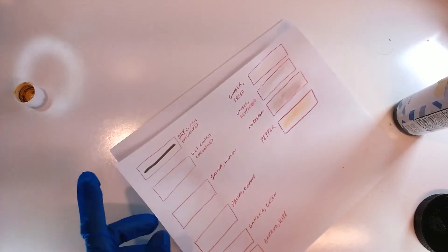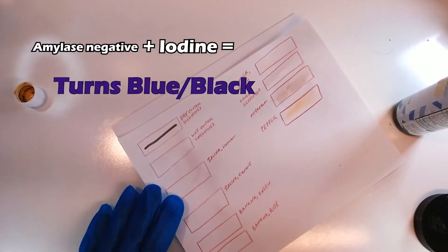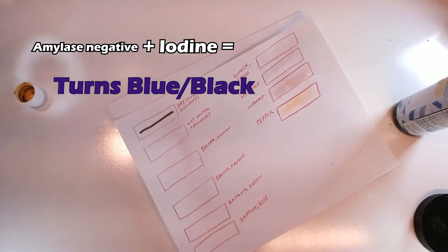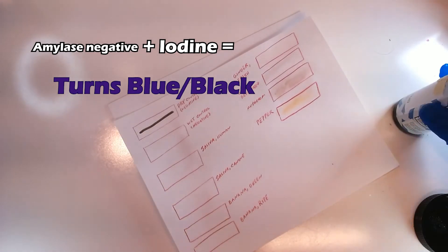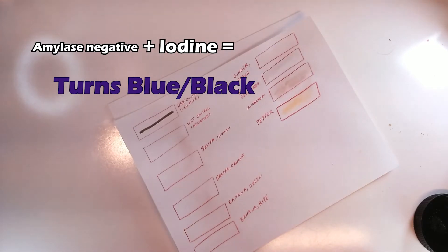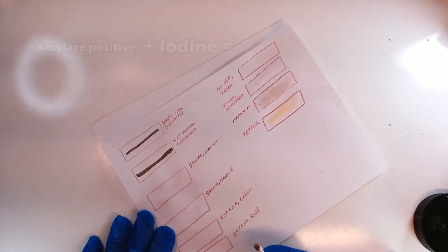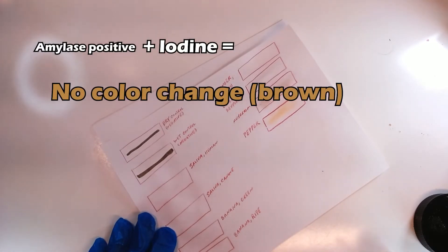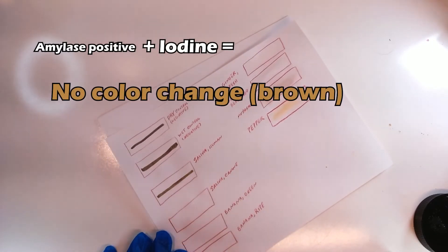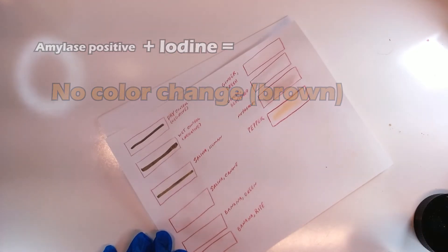As a reminder: if the iodine turns black, that means starch is present, and if starch is present, then amylase did not break down the starch — so black iodine means amylase negative. Meanwhile, if it turns any other color, if it remains brown or has a kind of yellowy-red appearance, then that substance is amylase positive.